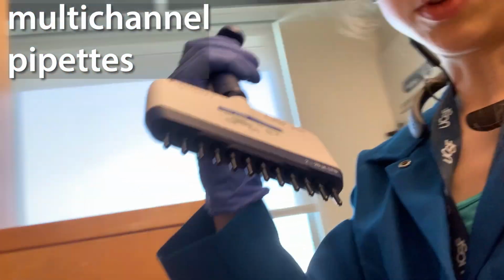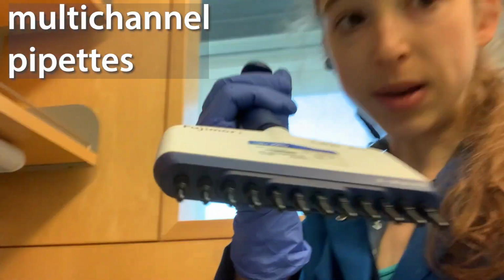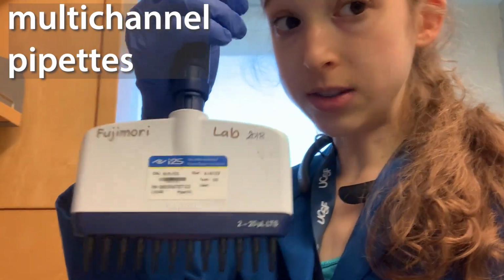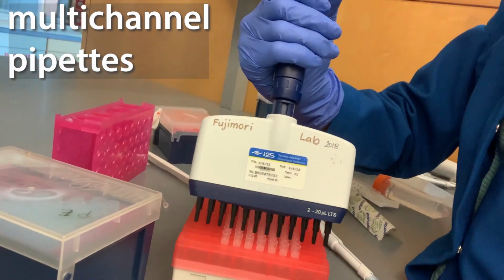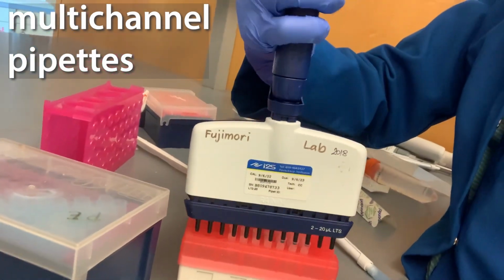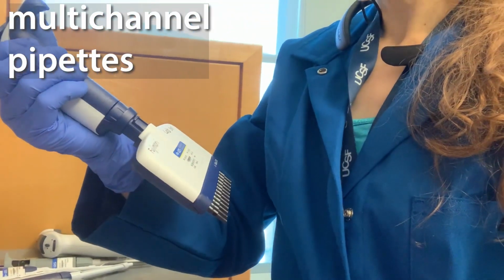Speaking of even volumes with the multi-channel, if you don't have a full width you want to do, it's best to use the middle of the multi-channel. That's going to be the most accurate. Instead of using half of a side or something, use the middle. That'll be the most accurate, the most even distribution between them.